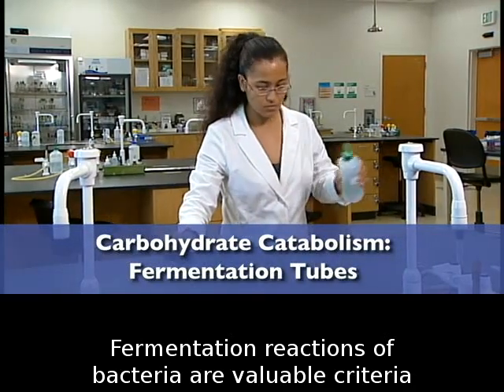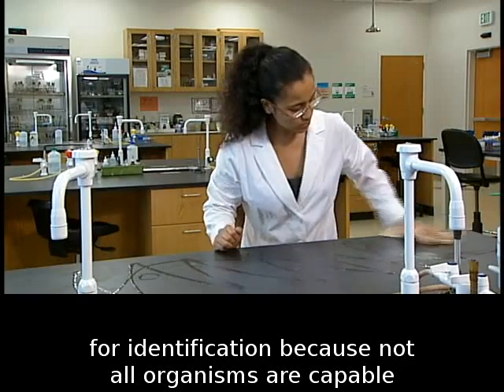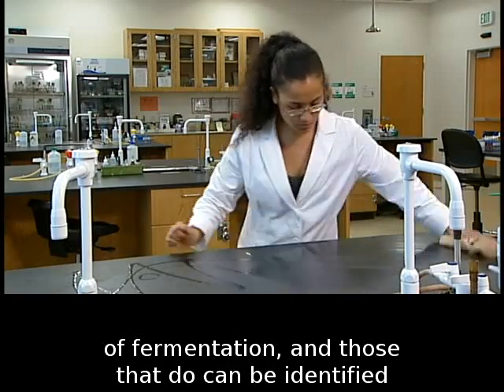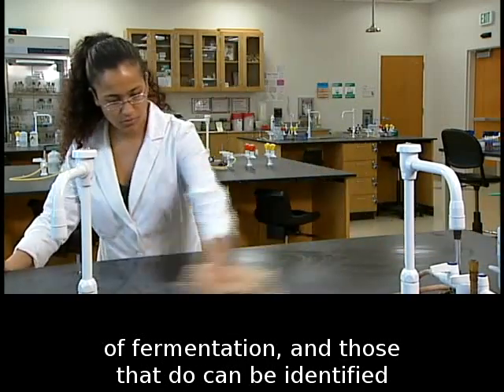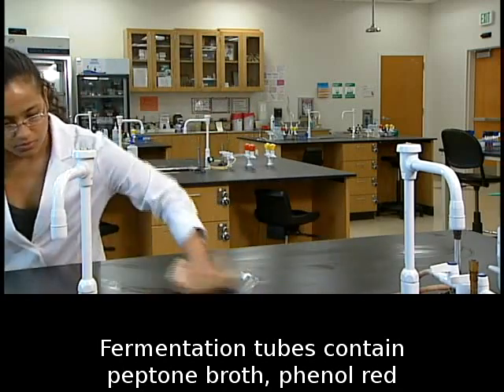Fermentation reactions of bacteria are valuable criteria for identification because not all organisms are capable of fermentation, and those that do can be identified by the sugar they are capable of metabolizing.